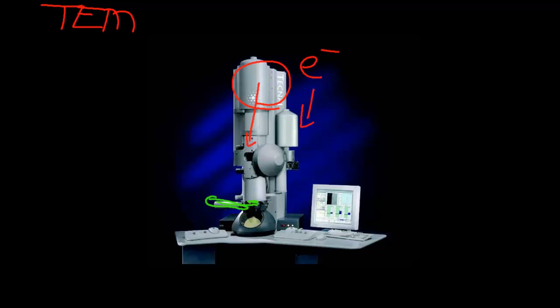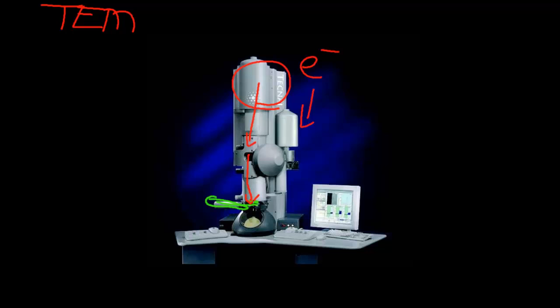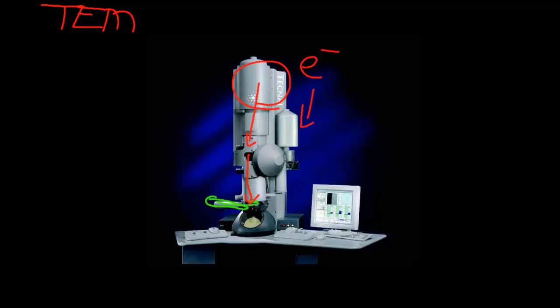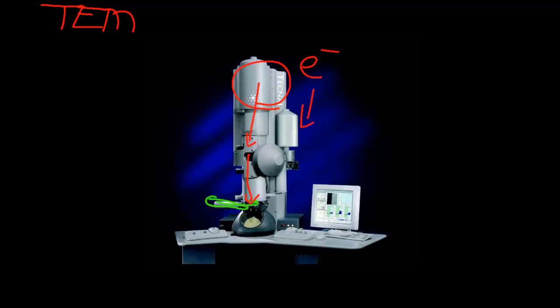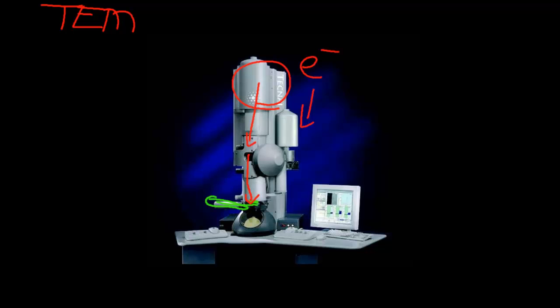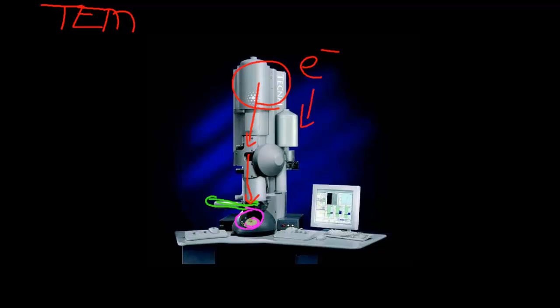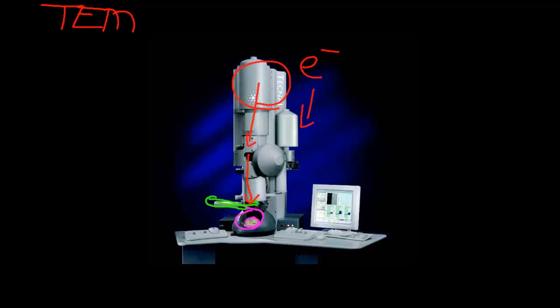As the electrons come down they go through the specimen. The way the specimen has been treated makes some parts of it absorb electrons, and other areas allow electrons to pass. This means some areas will look dark and some will look light. This window here is where the operator can look — you can see this fluorescent screen just in here. When the electrons hit it, it will glow a greeny colour.